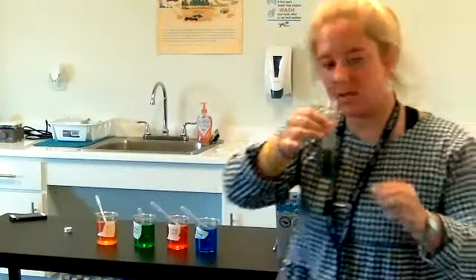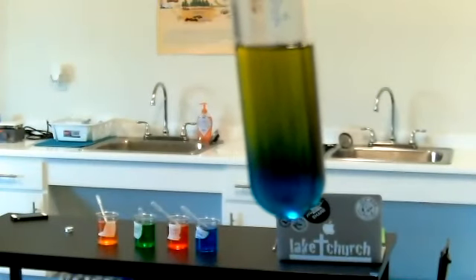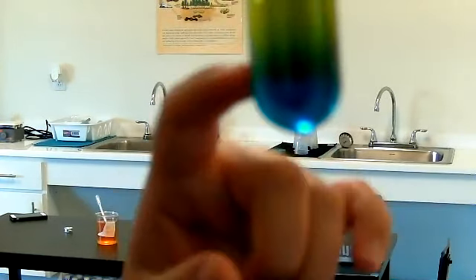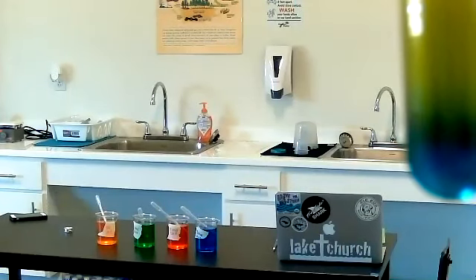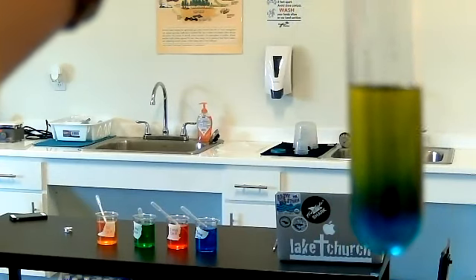So I'll bring it closer so you can see the results. What you should see is that the water — if you don't pipette carefully — you can see I lost my patience at the end because my green and my yellow mixed, and my red just a little bit. But you can definitely see that my blue layer is at the bottom, red is on top of it, green just a little bit mixed because I got impatient, and then the yellow sits on top. There's a distinct separation of those liquids.